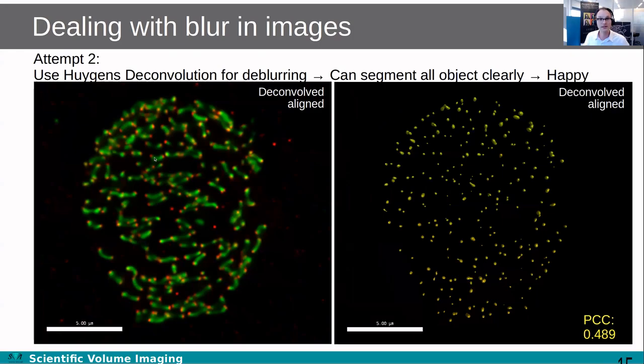So when you do the deconvolution, it's really great for deblurring. This is wide field data, and you can also get really fantastic 3D information from wide field data. Here you can see that all these individual kinetochores are colocalizing with the chromatin bridges in 3D, and it's just very effective for deblurring.